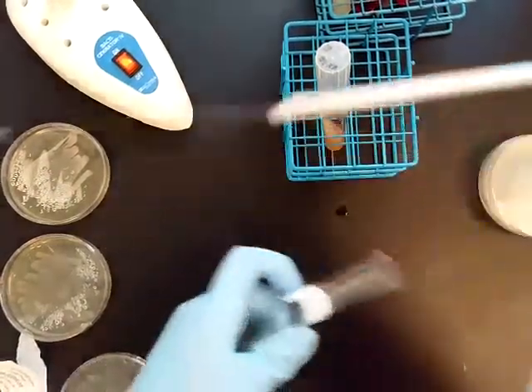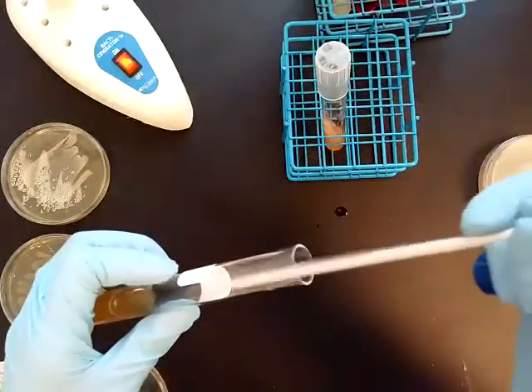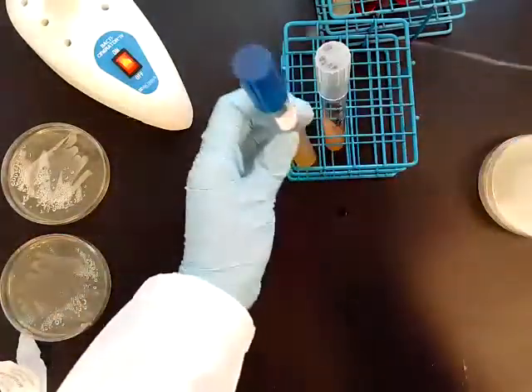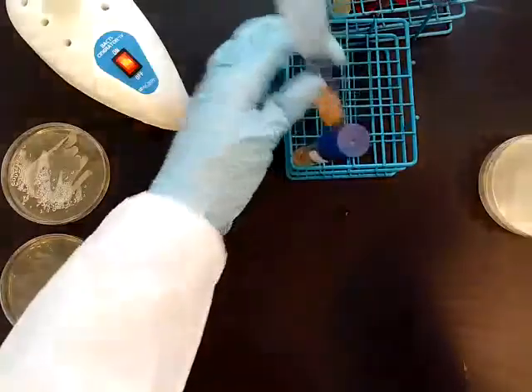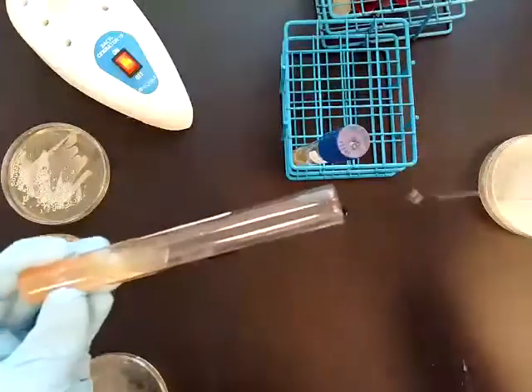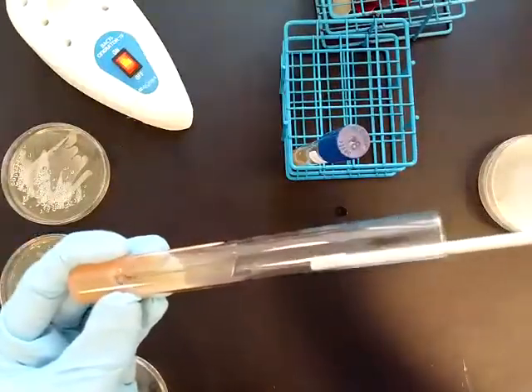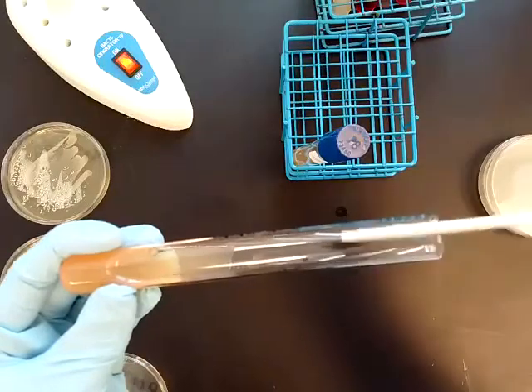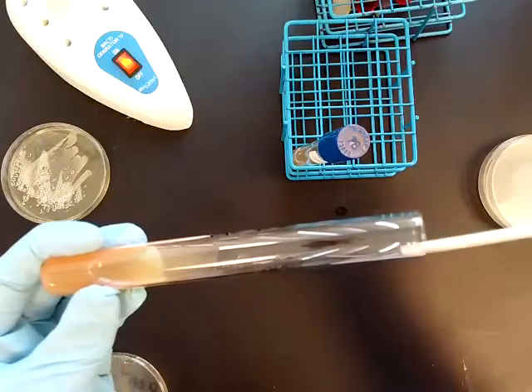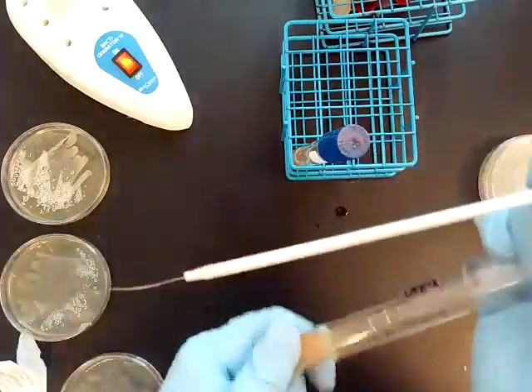Finally, I'm going to inoculate the slant. To inoculate it, I'm just going to start where the slant begins and paint up the surface of the slant.